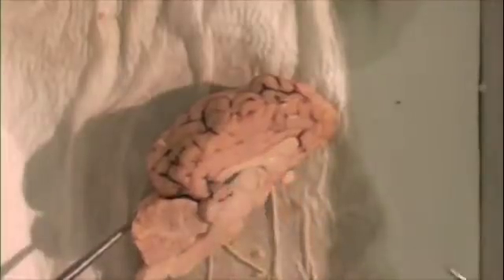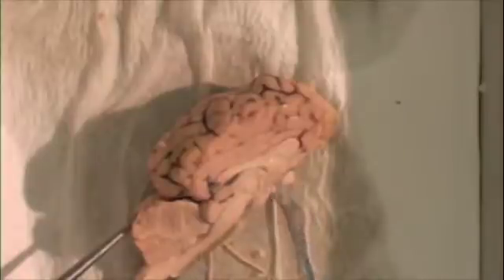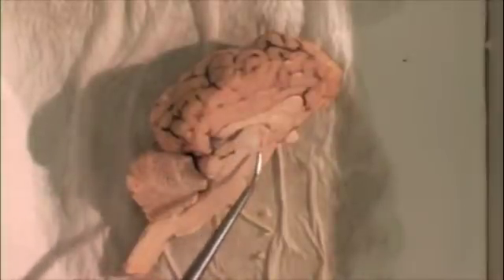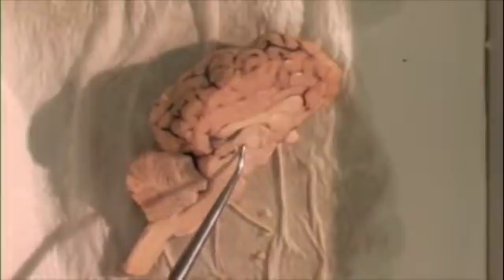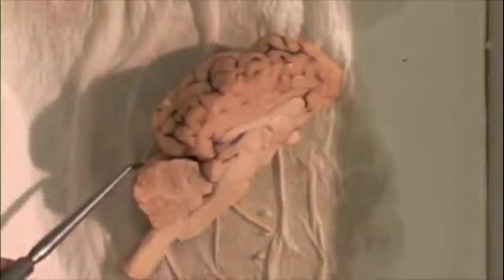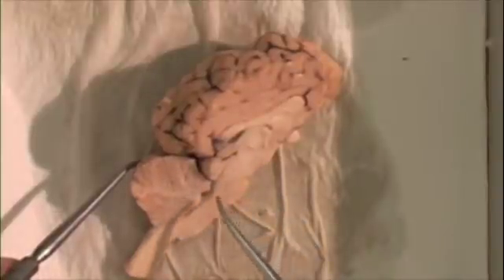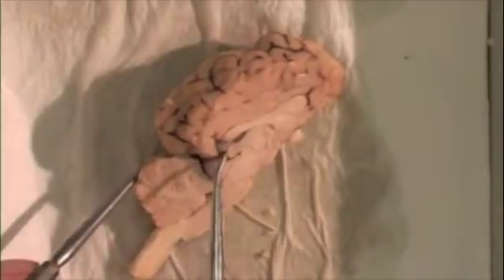In another view, we see the corpus callosum, the pons, the hypothalamus, and the midbrain. This round structure is the intermediate mass of the thalamus, and around it is a very shallow depression, the third ventricle. Between the cerebellum and the brain stem is a roughly triangular space, the fourth ventricle, connected by the cerebral aqueduct to the third ventricle. In this view, you also see the corpora quadrigemina and the pineal gland.